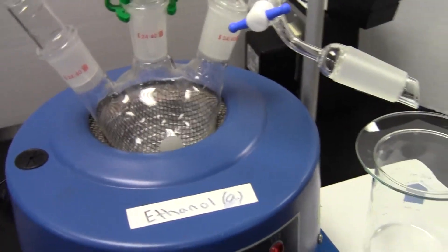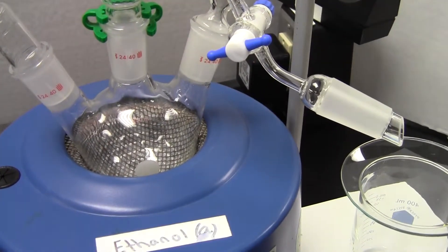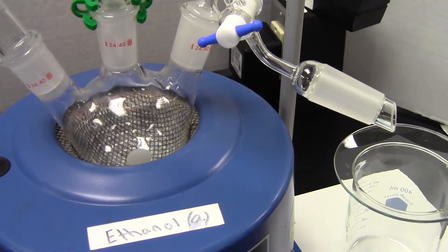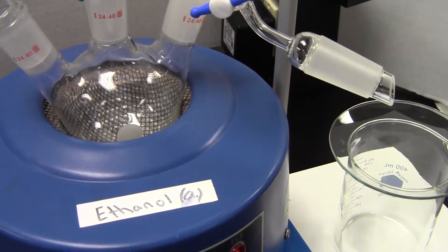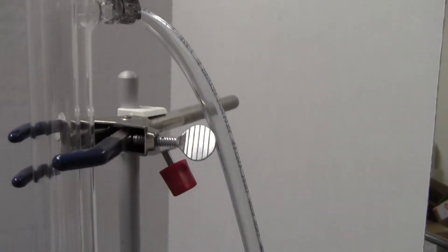Once you've recorded the boiling point of ethanol, make your first addition of cyclohexane. You can do that with a Pasteur pipette right through the condenser. If you put on a drying tube, you'll just remove it—nothing should be coming out anyways.